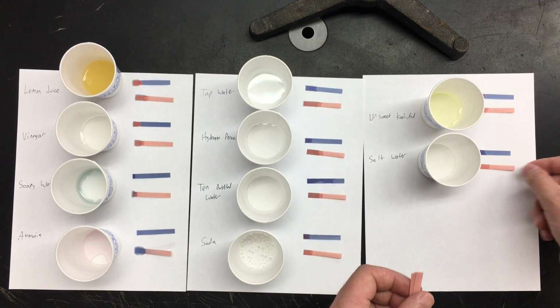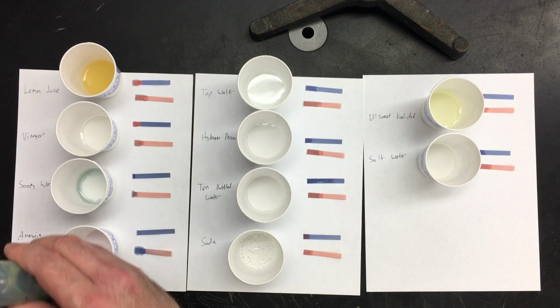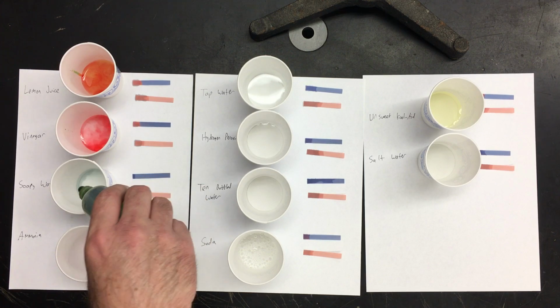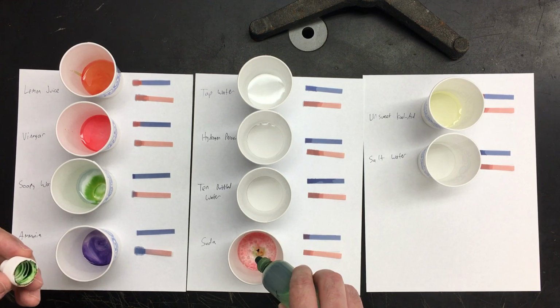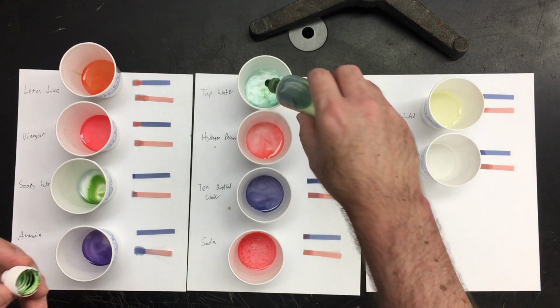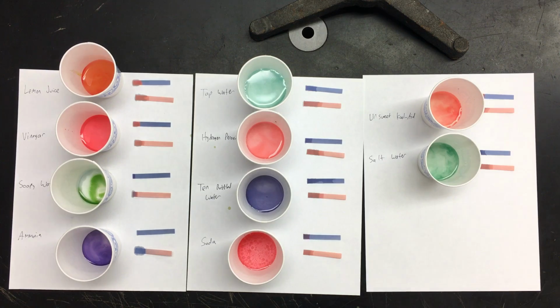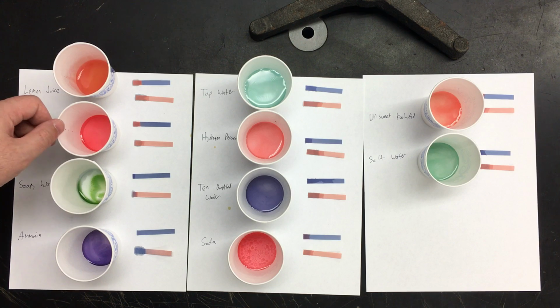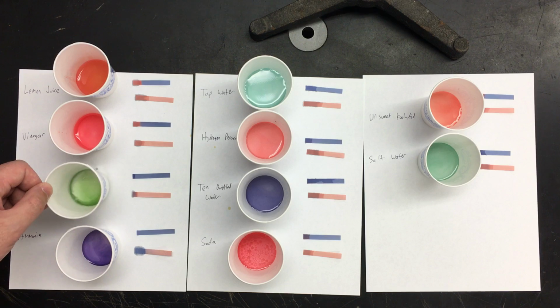Okay. All right, so with the red litmus paper and then the universal indicator, I'll drop a few drops in each, and you can see if there's any kind of color change, or what the color change happens to be. So there we go. There's the lemon juice. Now the lemon juice itself is a little bit yellow on its own, so think about what color the indicator might have changed to if it mixes with yellow.